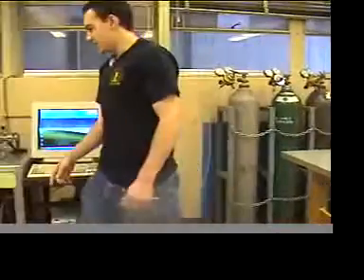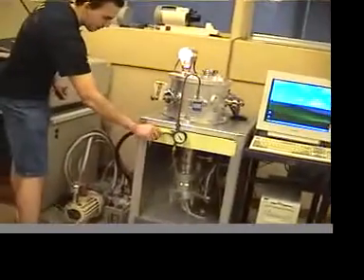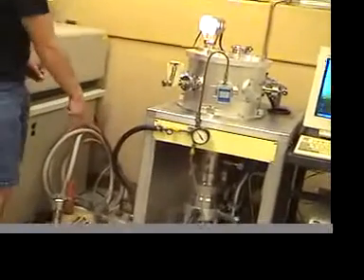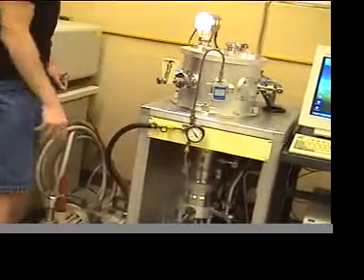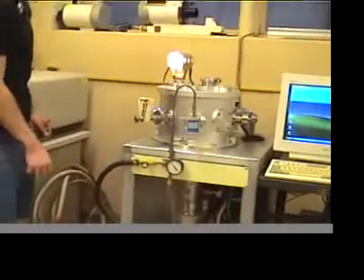You come over to here, and there's this little knob here. You want to open this up. It uses this small vacuum here to vacuum out any of the contaminants that might be in this line. You want to let that run for a couple minutes.